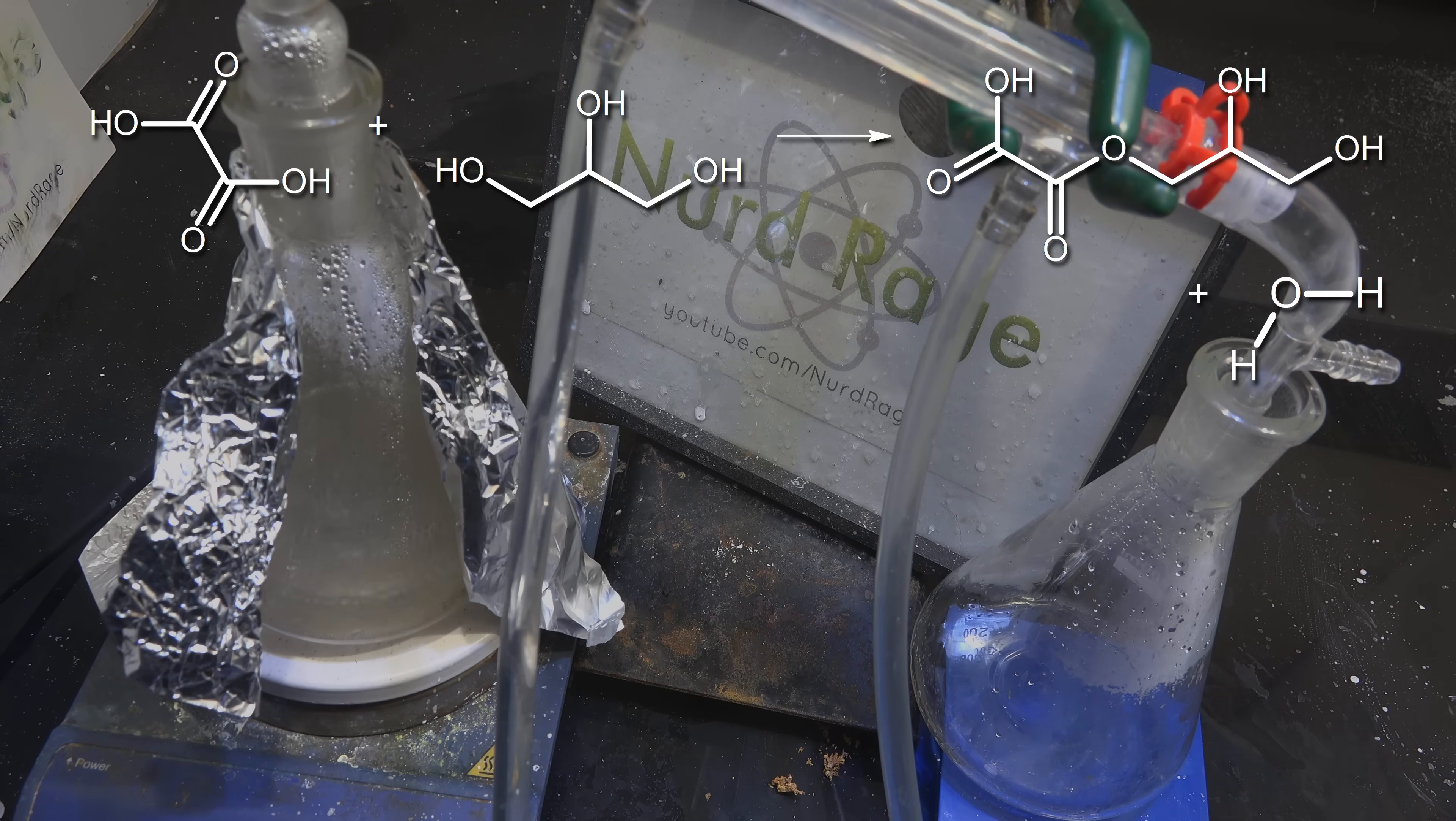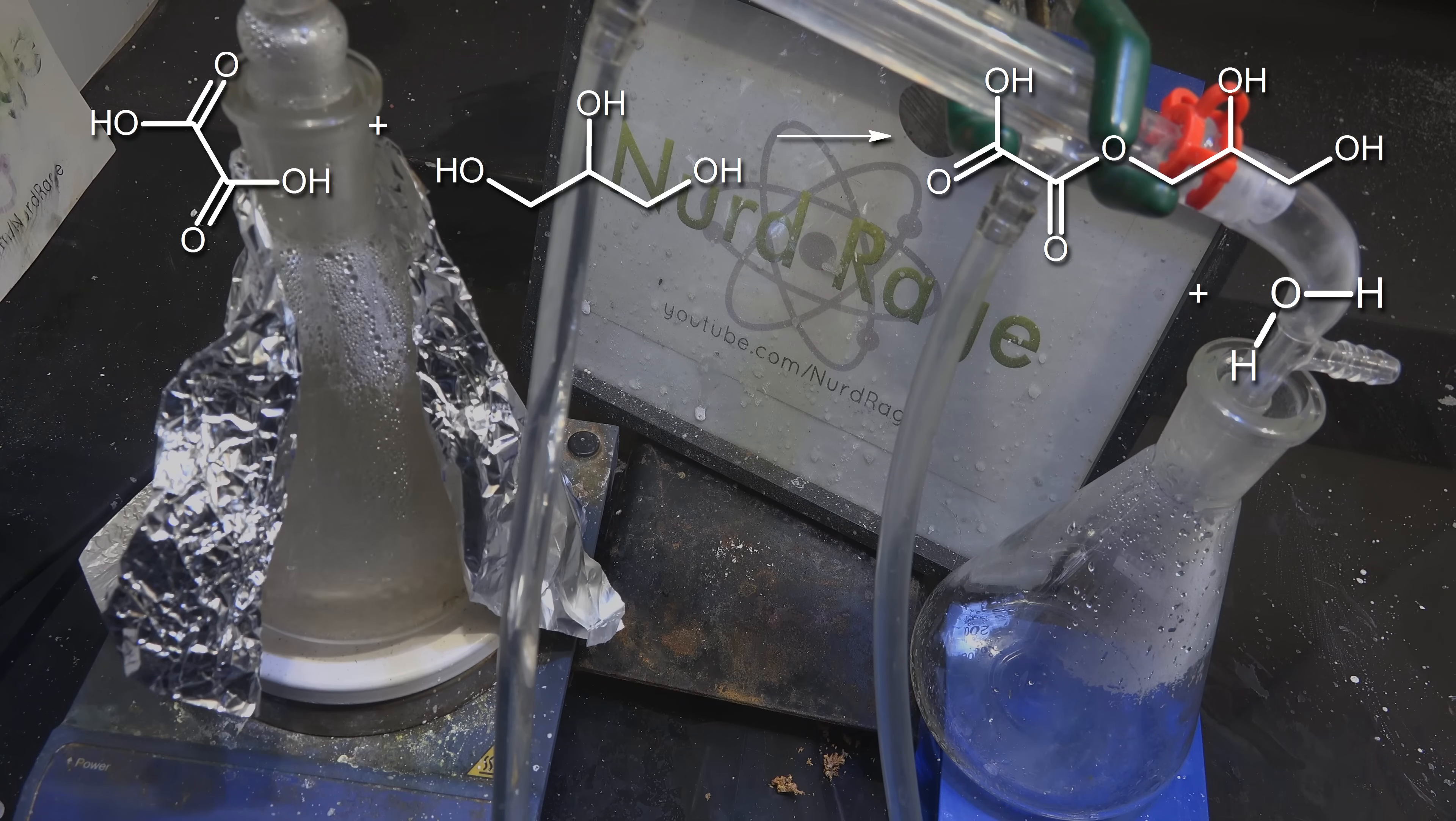Then as the mixture loses water, the oxalic acid reacts with the glycerol to produce glycerol oxalate ester.